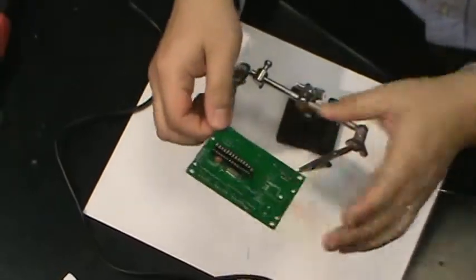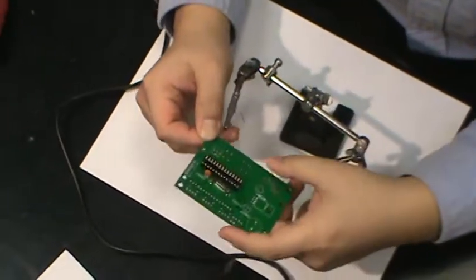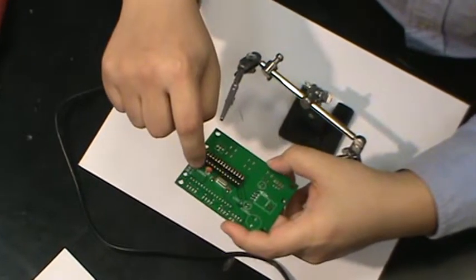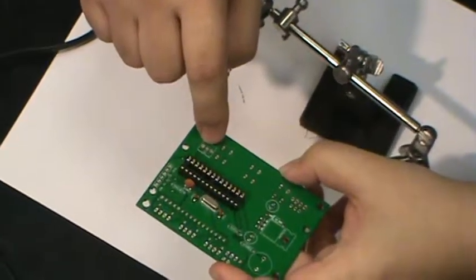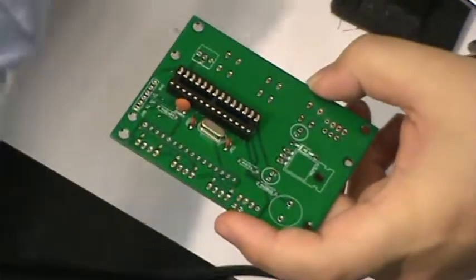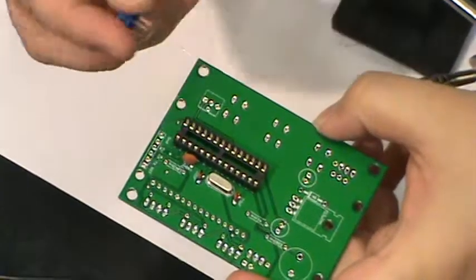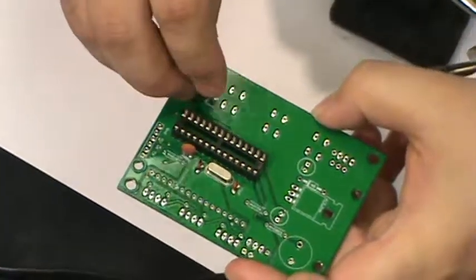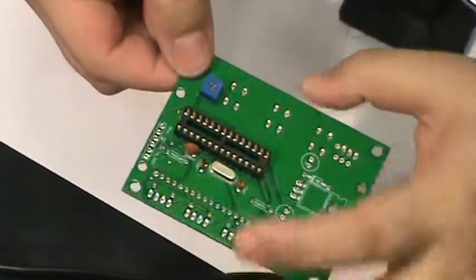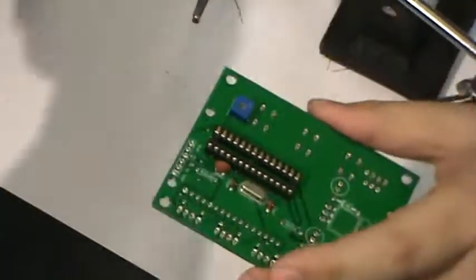Okay, so let's see what else we want to put on this circuit board. We can decide to put the resistor here. Here is a variable resistor or potentiometer, and a few capacitors. So this one here is a potentiometer with 3 pins. Drops in like this, and again flip it around. Just flatten these pins so the part will just stay pretty well.